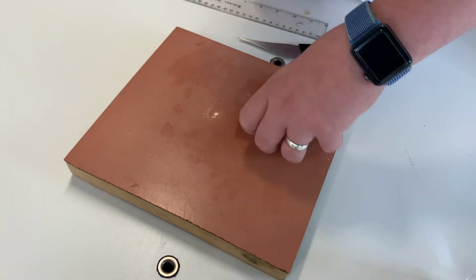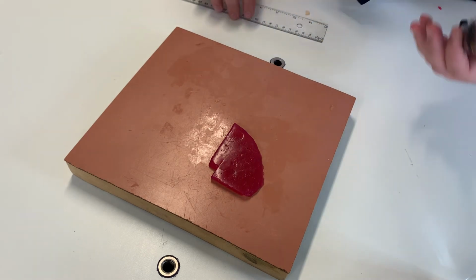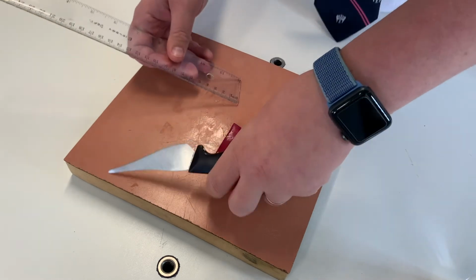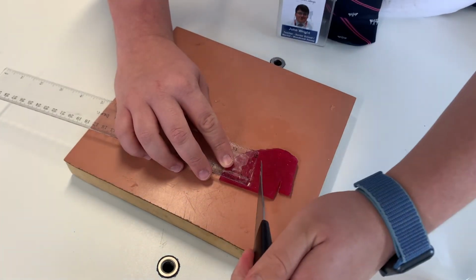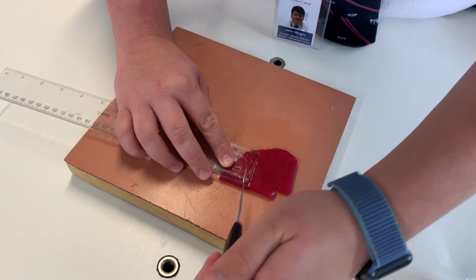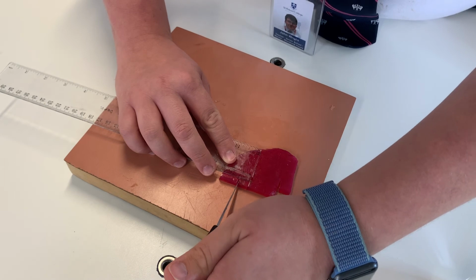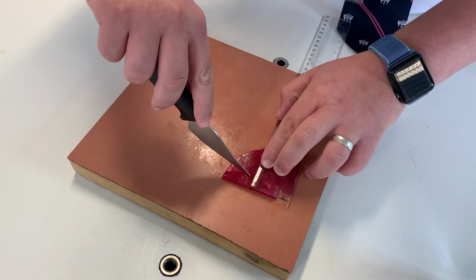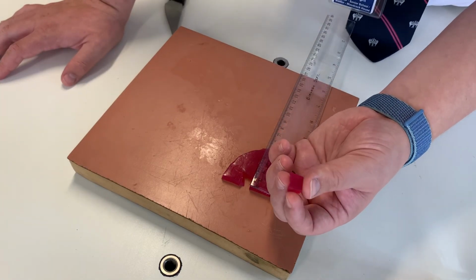Finally, we'll do this with some gel that's 1 centimetre thick. This is a different colour because it's from a different batch of agar. It's still the same gel. We want to have 1 centimetre thick. And we now have our 1 by 1 by 1 cube.